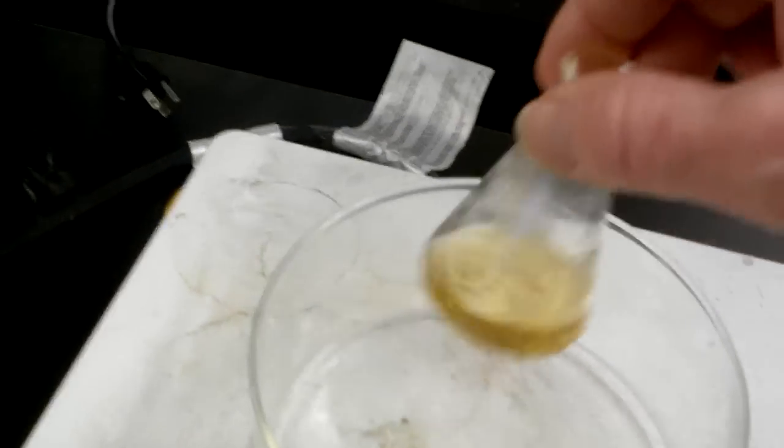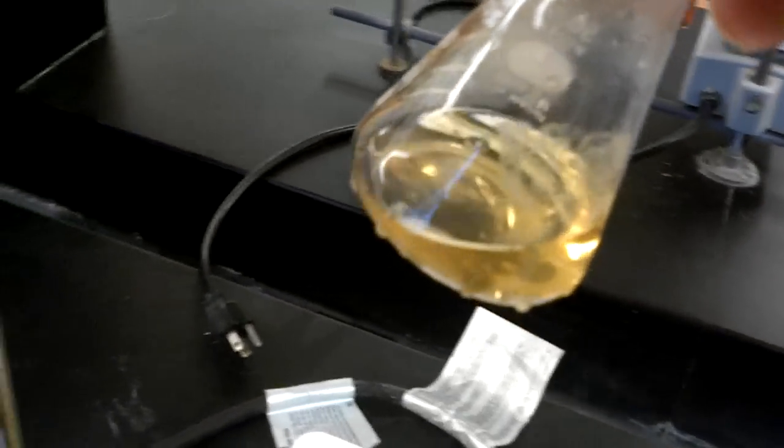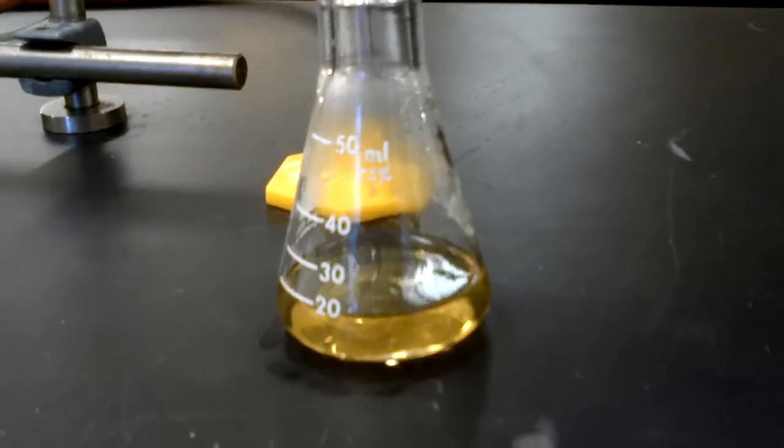Okay, it took a minute, but here we are. The product has dissolved nicely, so that's our nitromethyl benzoate. I'm just going to set that there for a moment. Perhaps we can watch the crystals grow.